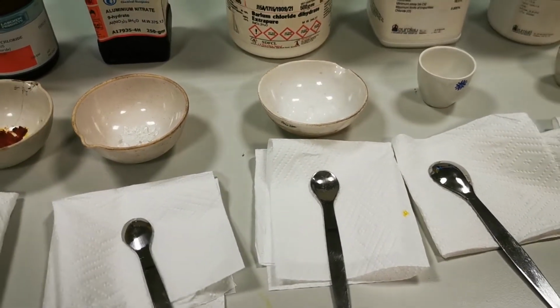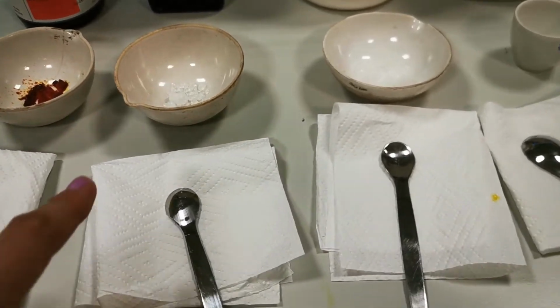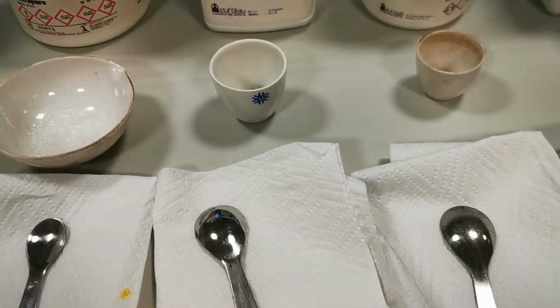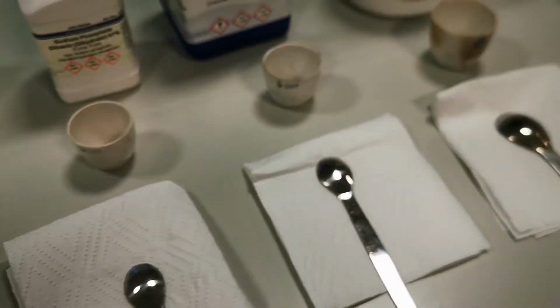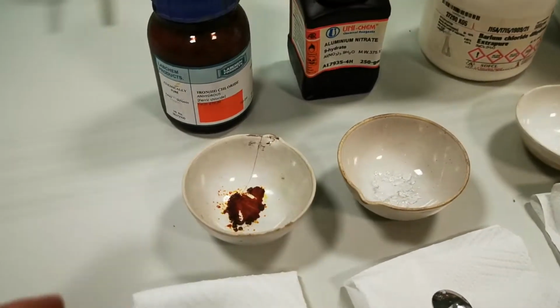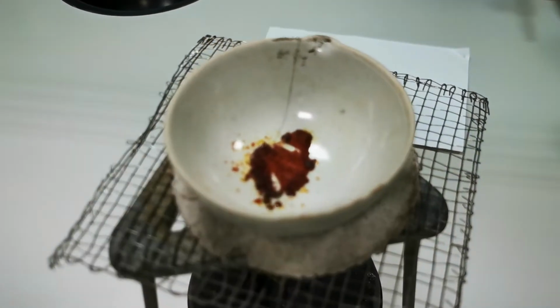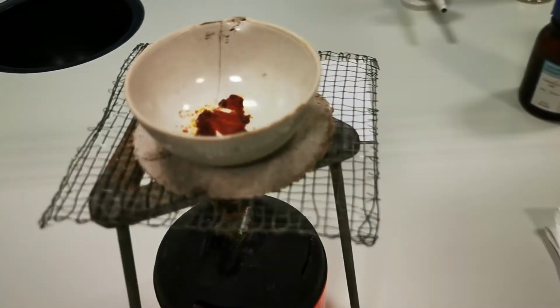contain hydrates. What we're going to do, first of course, you measure the mass of the evaporating dish or the crucible empty, and then you add to it a certain mass of the unknown hydrate, and then you subtract their masses to see how much is the mass of the hydrate. Of course, the hydrate contains water. And now the next step, each one of those, you are going to heat on a Bunsen burner until all the molecules of water evaporate.